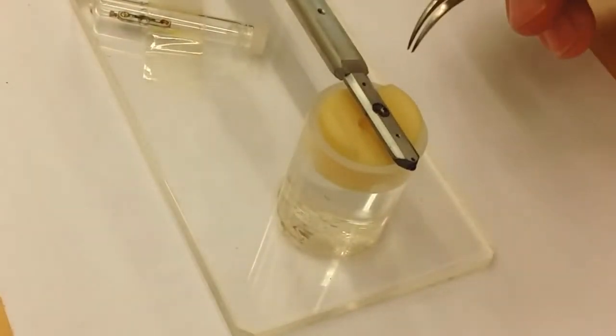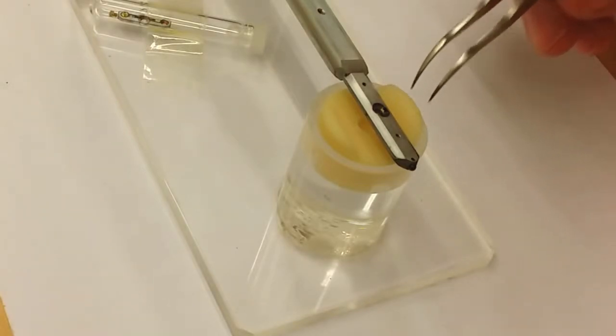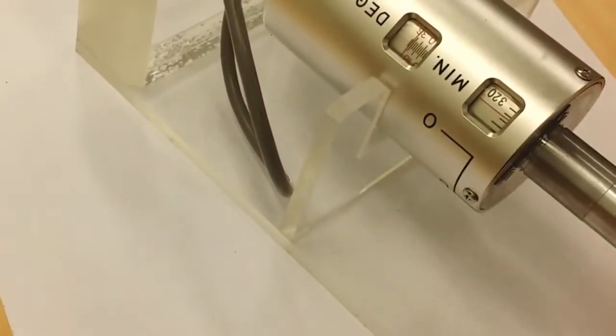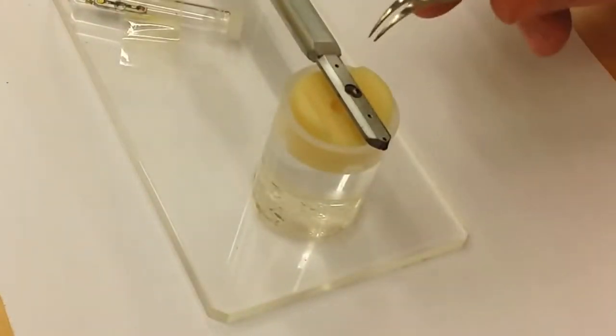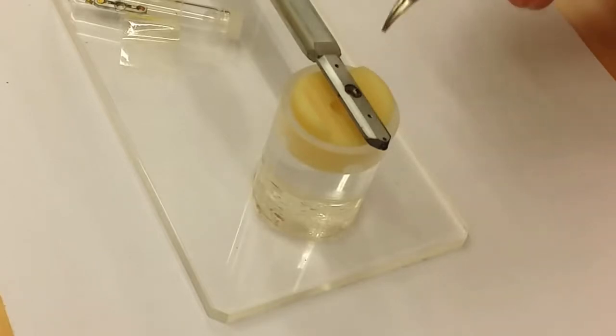The third sample holder only has 1 slot for the sample here. But this is a much more advanced one, because if you look downwards on the top here of the holder, you can see it has an electric motor that actually can tilt the sample. So by using this holder you can tilt this sample in 2 orthogonal directions. That means it's much more suitable for crystal analysis.